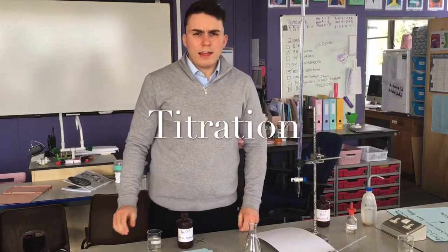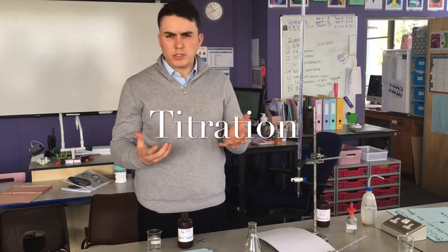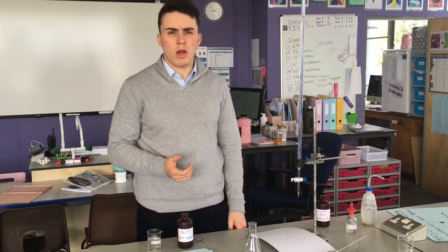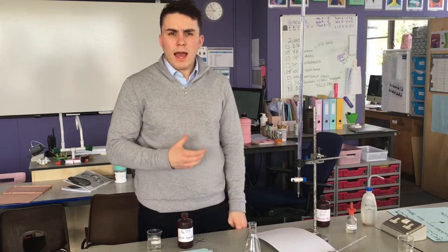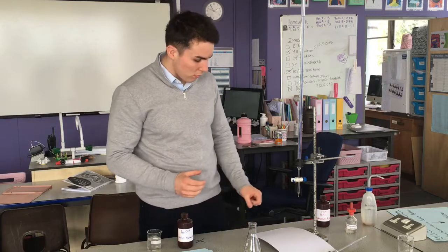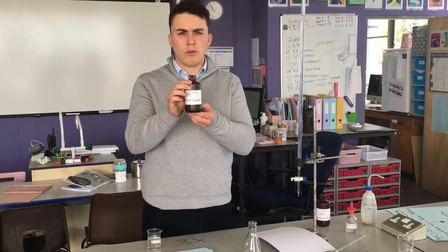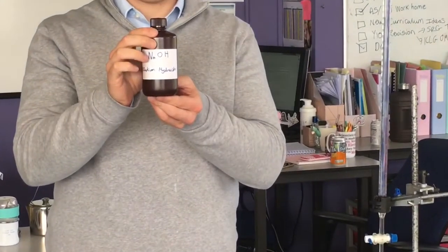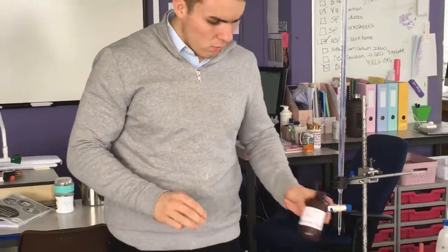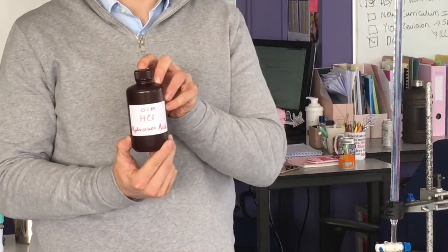We're going to look at a titration. A titration is a way of measuring the concentration of an unknown acid or base. Today we're going to be looking at finding the concentration of an unknown base — we're looking at sodium hydroxide — and we're going to react that with 0.1 molar hydrochloric acid.